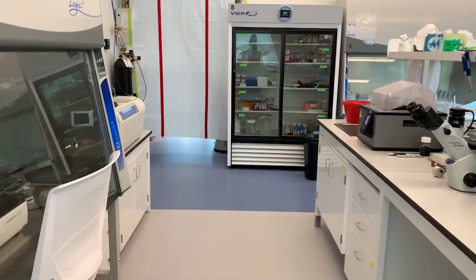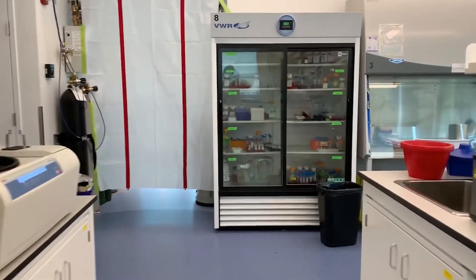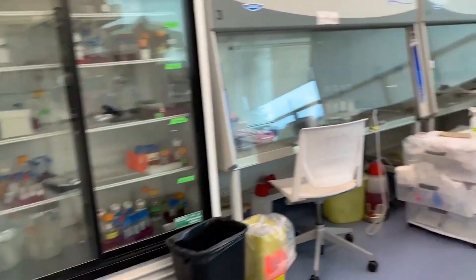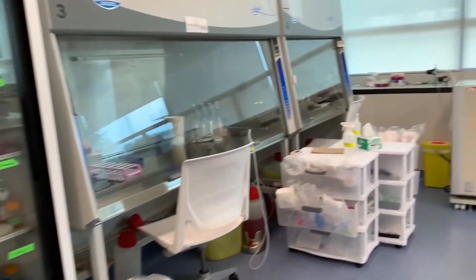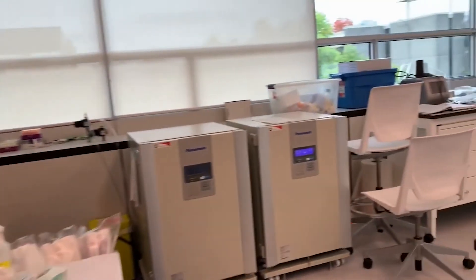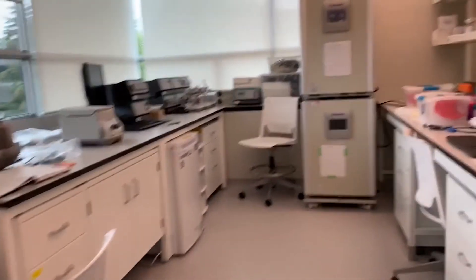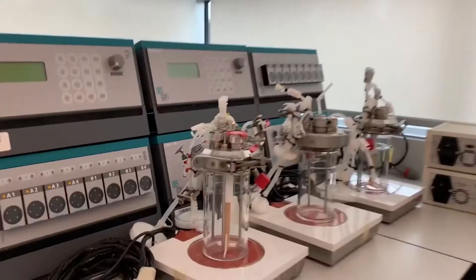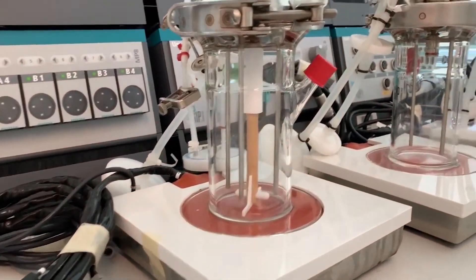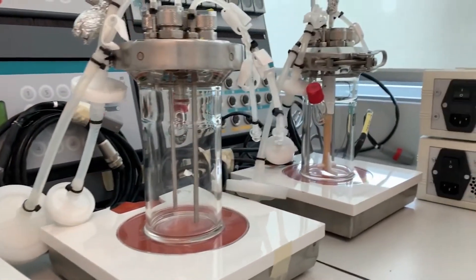Let me now show you where cells can grow in a 3D environment so that we can scale up their production to engineer clinically relevant cells at a large scale. These are bioreactors, with which we can control the cell's environment using fed batch systems.